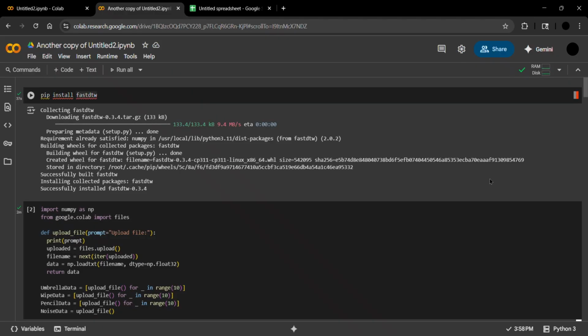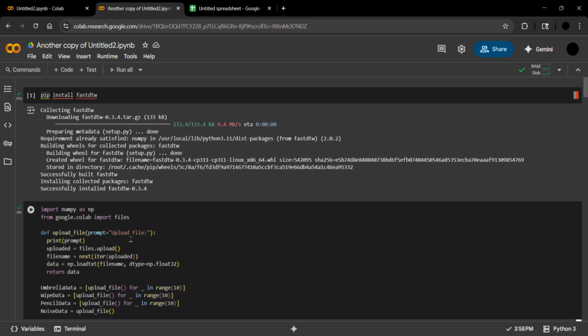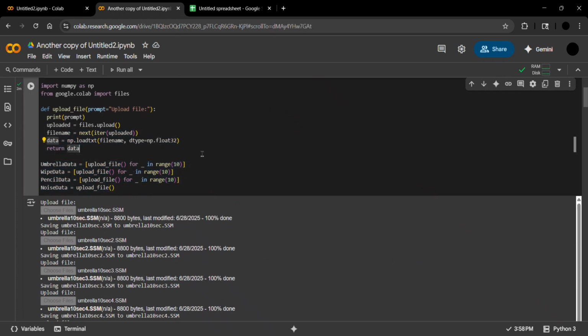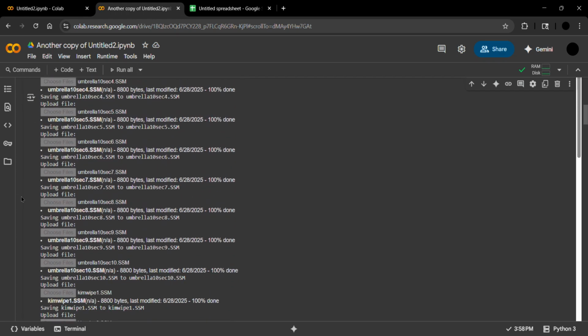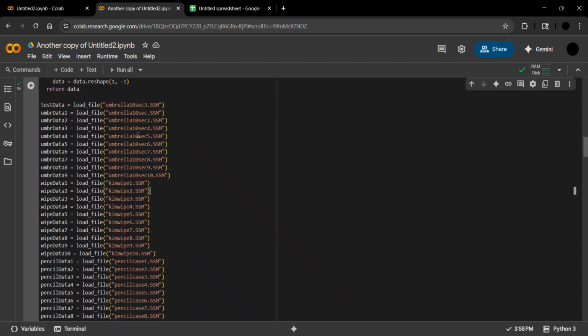Here we have the second Python file in which the comparison algorithm is used. Instead of cotton and polyester data, we have object data of an umbrella, Kimwipe, and pencil case. The first thing done again is importing the external dynamic time warping library. Here we have the 3 datasets mentioned previously, as well as the noise data, which is the laser running for 10 seconds without a sample being used, which will be subtracted from the datasets previously mentioned as a form of noise reduction. Here we load in the data files, which are SSM files again from MATLAB.